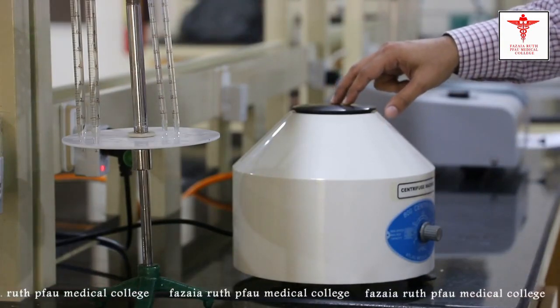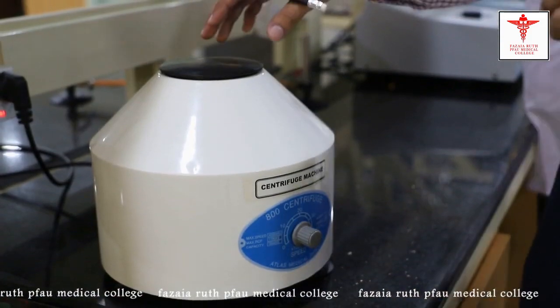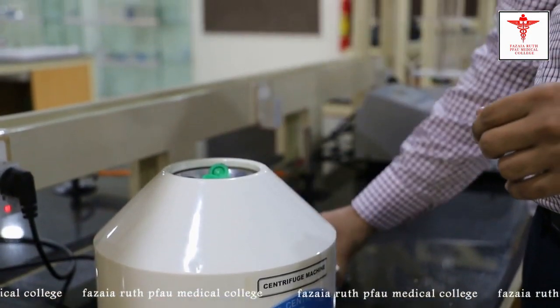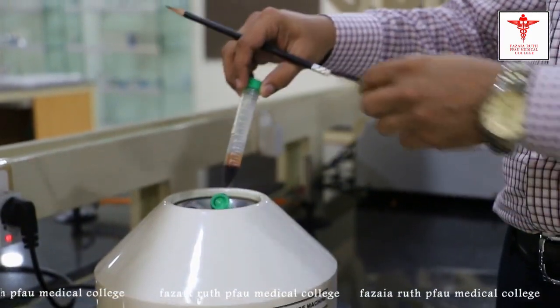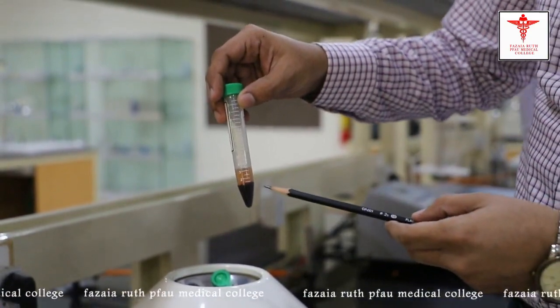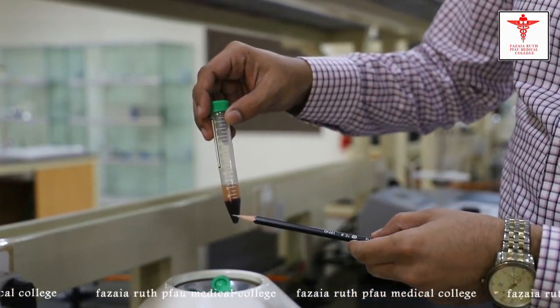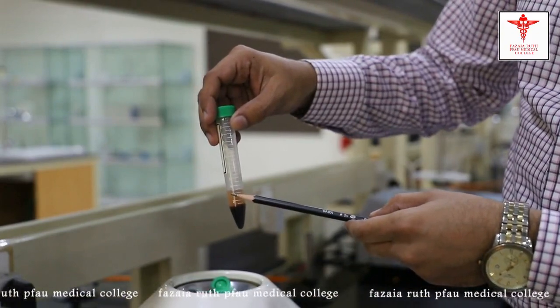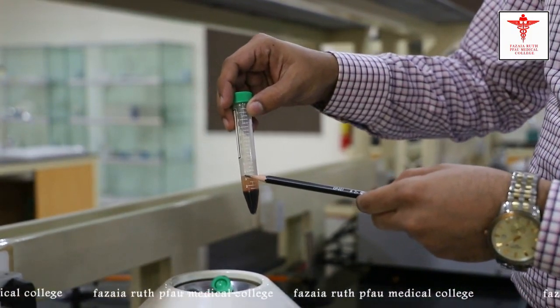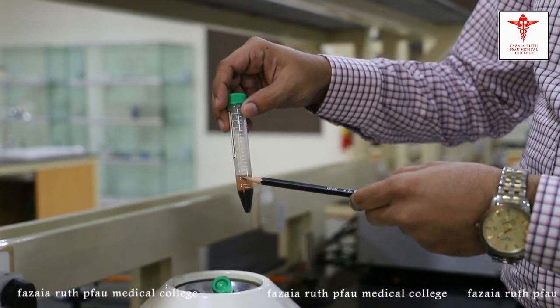We'll set the RPMs and centrifuge this whole blood sample. Now we'll take out the tube — we have centrifuged it for 20 minutes. This is the result after centrifugation; you can see the cellular components have separated out, leaving behind the plasma. This plasma at this stage contains some protein.